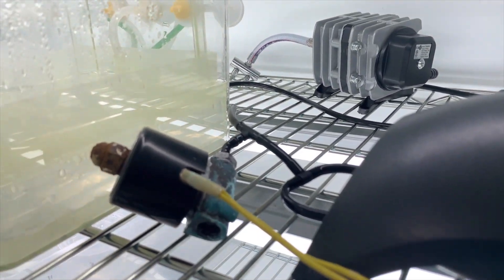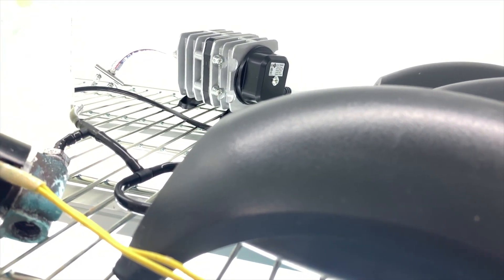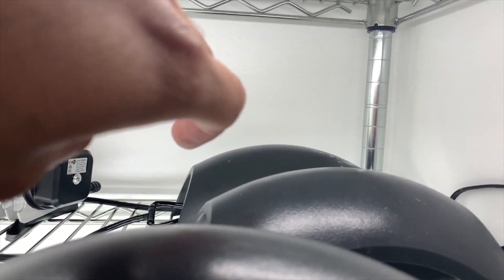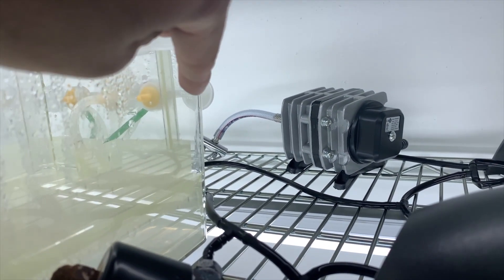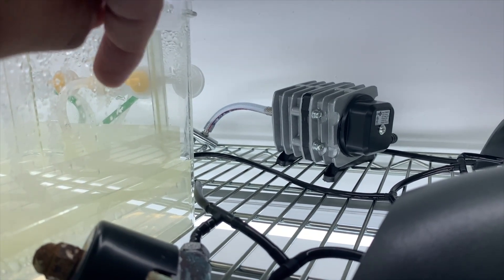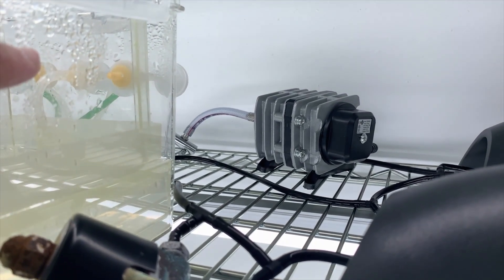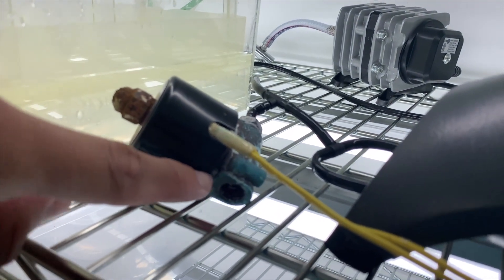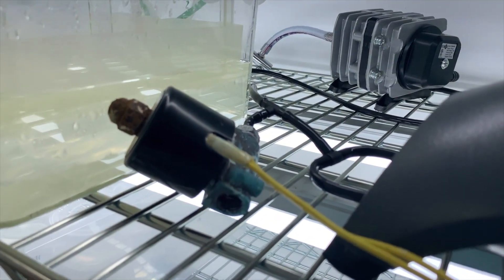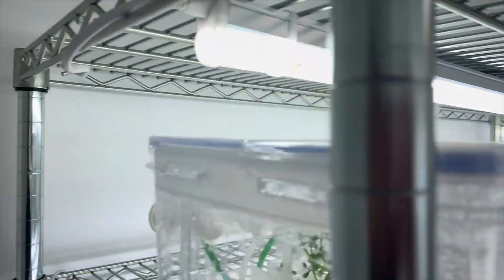So what's going on is that the solenoid is connected to the first pump. However, when these other pumps are pushing air, which is going to one of the other filters on the side, the air coming to the middle on the green tube has to go somewhere. So that's why the solenoid has to open, so it lets the air out. And I hope that's a little clear, but probably not. So let me see if I can explain a little better.